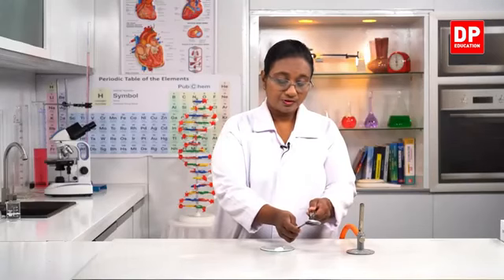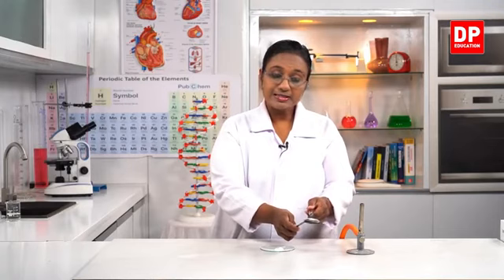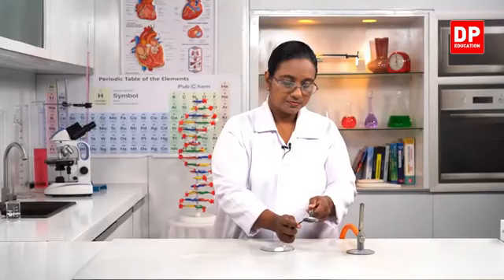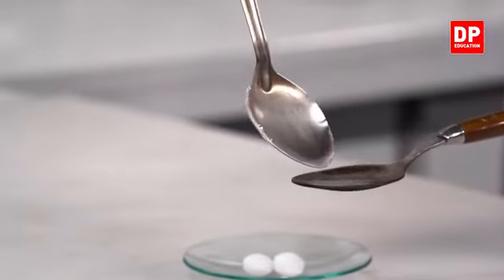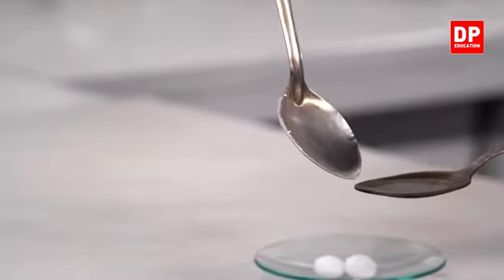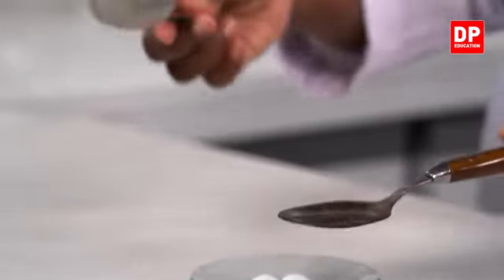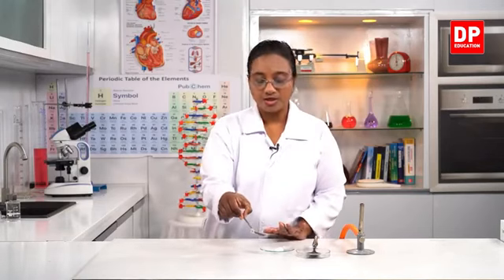You will have to hold it for quite some time so that the vapor that is going off from the naphthalene gets condensed on the other spoon, the second spoon, because the second spoon is cooler than the first spoon. So now here students, you all can see the shiny solid substance at the edges of the spoon. So what happened here? When we keep this aside also, you all can see the changes taking place again. At the same time, you all can see the shiny solid substance on the sides of the spoon.